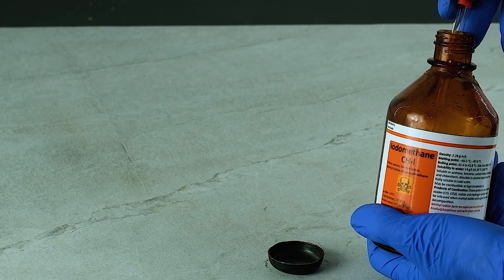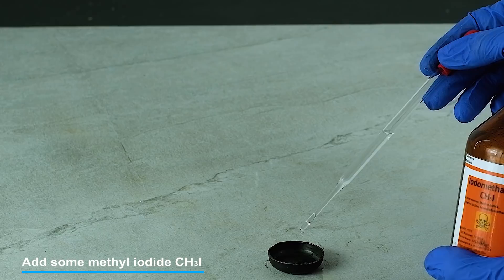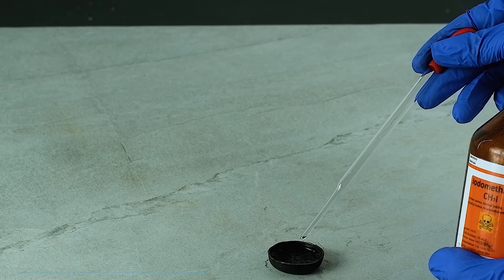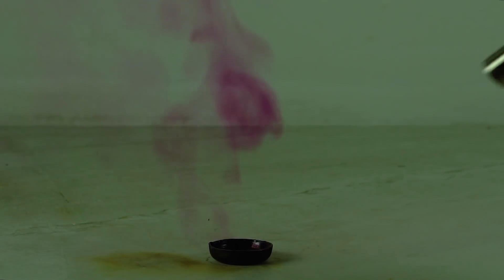For the next reaction I used methyl iodide. Methyl iodide is very hard to set on fire in air, because elemental iodine released during slow heating prevents burning. However, it burns very well in combination with liquid oxygen.